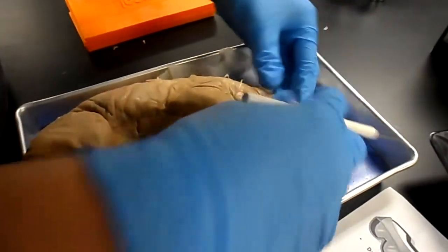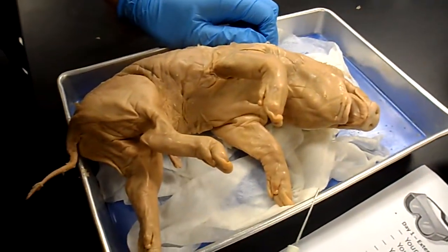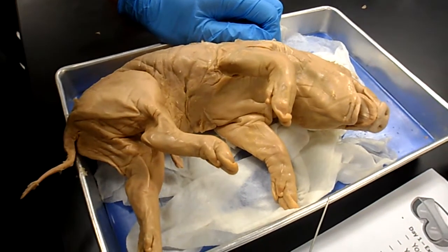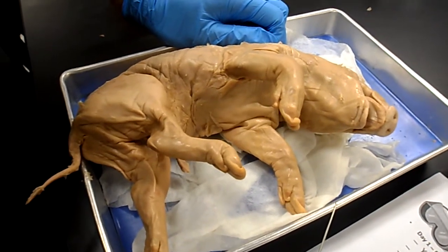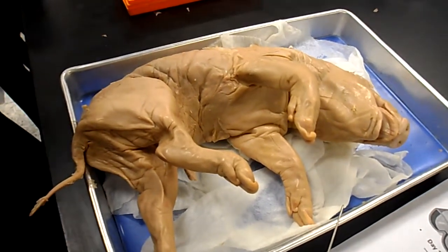My name is Louisa and Terry. The pig's name is Oink Oink. The pig's sex is female, and the pig's approximate age is about 100 days.